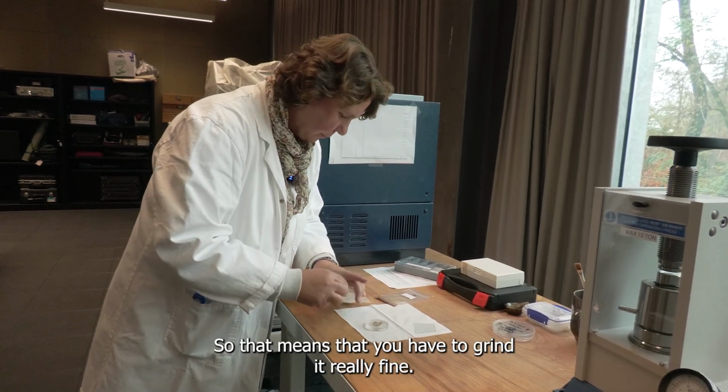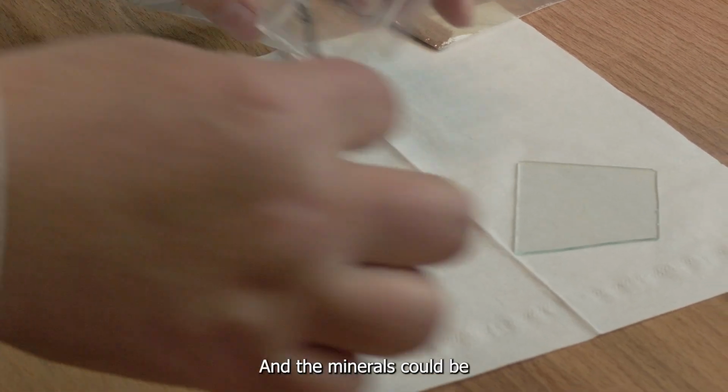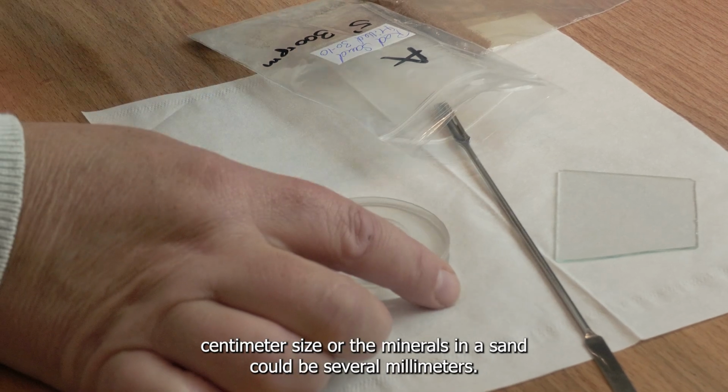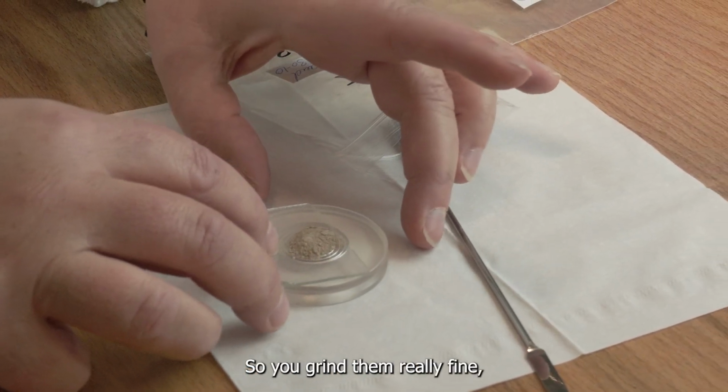So that means that you have to grind it really fine so that all the minerals from that rock, the minerals could be centimeter size, or the minerals in the sand could be several millimeters, but you want them all to be present in that little scoop of material that you take. So you grind them really fine.